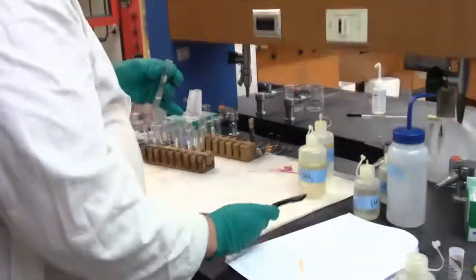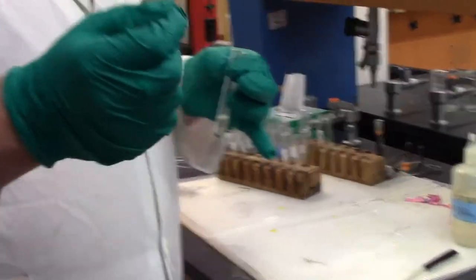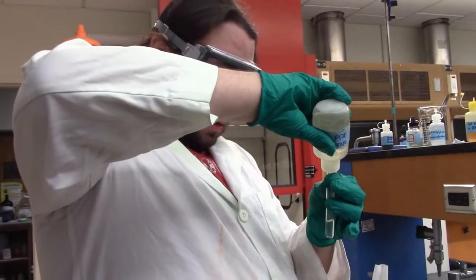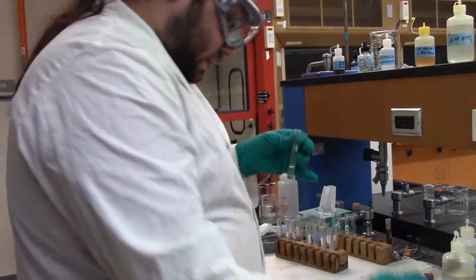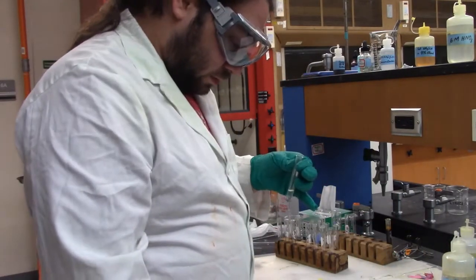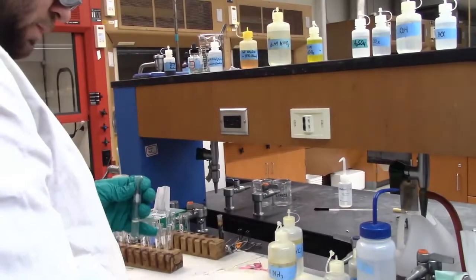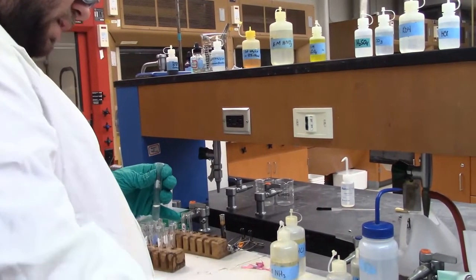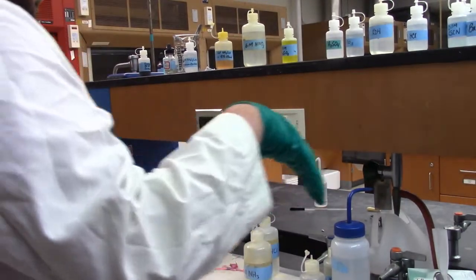Let's see, have we done anything? Yeah, since acetic acid is pretty weak, we're not really going to get it to be a bright red, but we have pretty much neutralized it, which is what we want. Just to be on the safe side, though, I will add a few more drops of that. Give it a good mix. And yeah, like I said, it's not going to get any more than that. So we're good. So now we add some barium chloride. This is going to be up here somewhere. There it is.